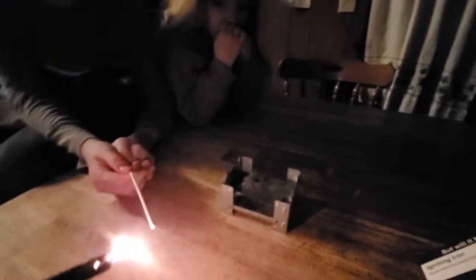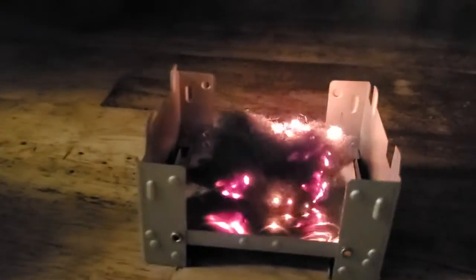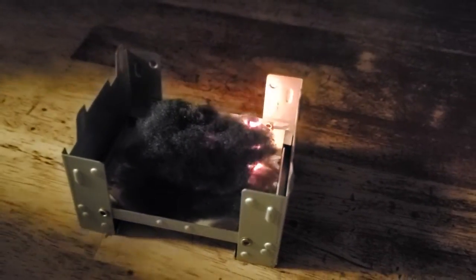Is that good? Leave that back one on. That's it. Look at it. That's cool. How many times can you do it? It's going to go all the way around. Light it and then turn the light up and watch it. Look at that. See it?